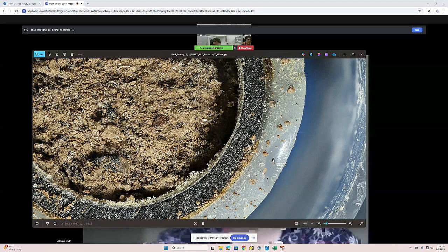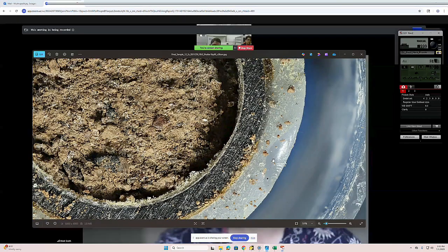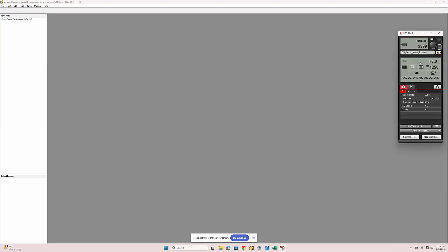That's good, and then obviously the shutter was different. Oh, the shutter was different. Yeah, it was 1/100. I used 1/60, I guess it's not letting me change it. It's not letting you change it? No, I don't know. Is there a reason? This could also very well be your issue.